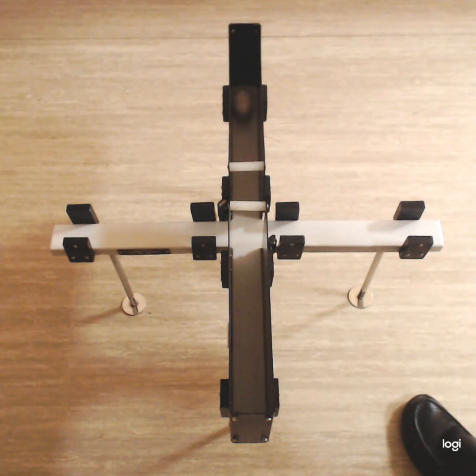When you give the mice diazepam and you study the mice using this elevated plus maze, it will clearly show anti-anxiety properties. That is, you will see it is spending more time in open arms, you will see more head dips compared to the control group, and also vertical rearings.